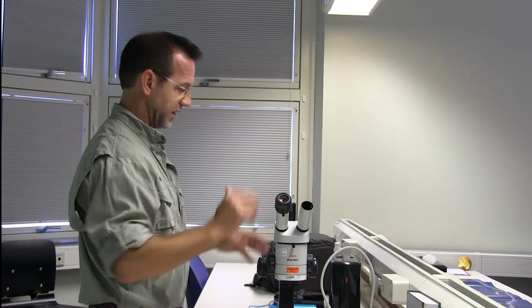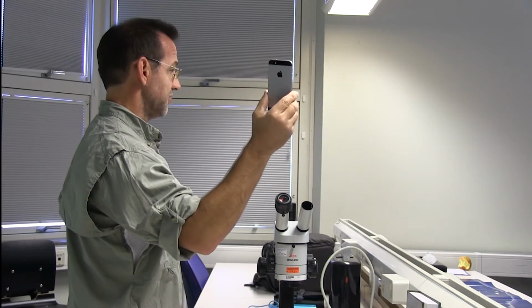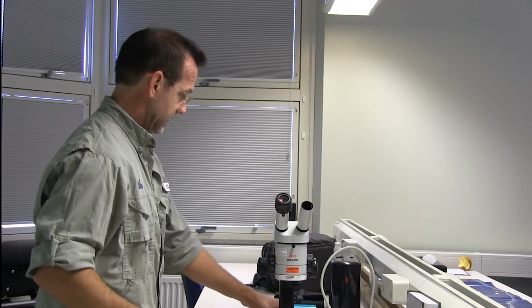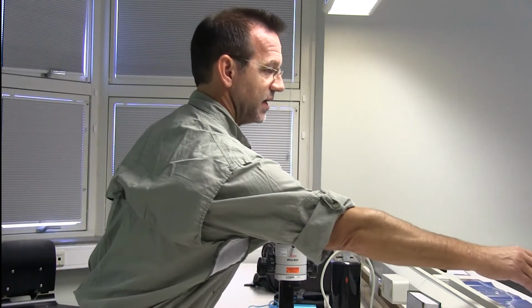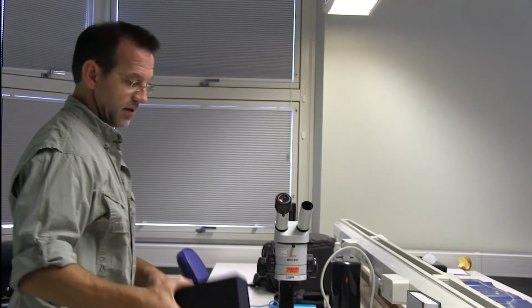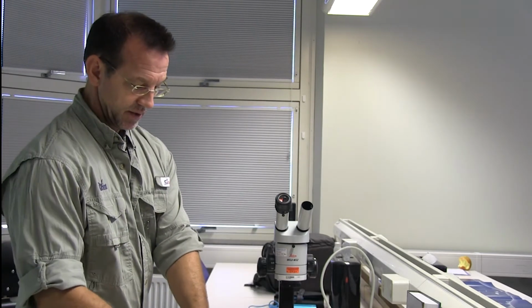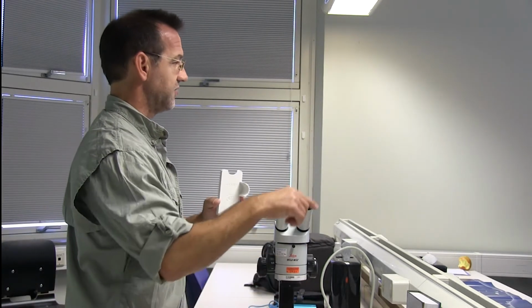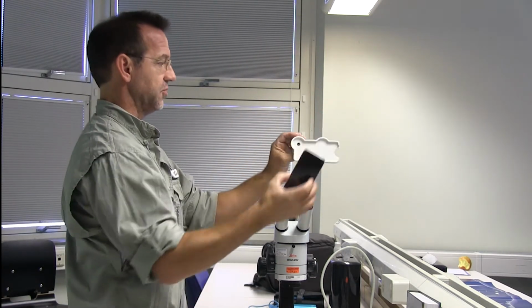Then you move on to more of today's technology, where here is your camera, right? So the advantage here is that most everybody has a phone, and most students have a phone. So one of the newer ones, and I can pass this around so you can see it. So this company develops adapters for the iPhone. I don't think he's doing Android yet, but this is the adapter using the same principles as the one I just showed you. So here is the adapter for this specific size phone.